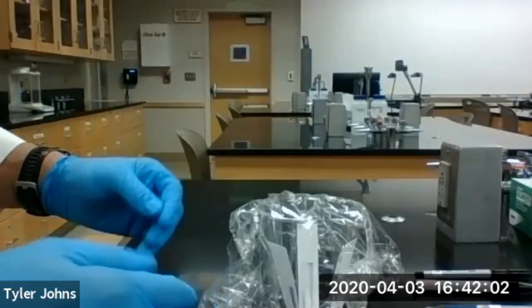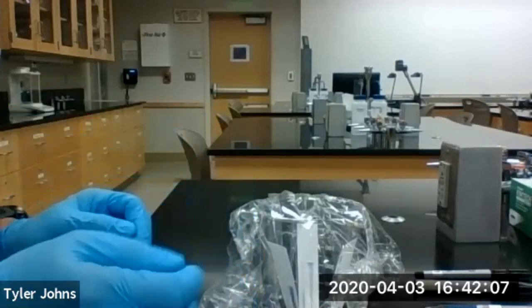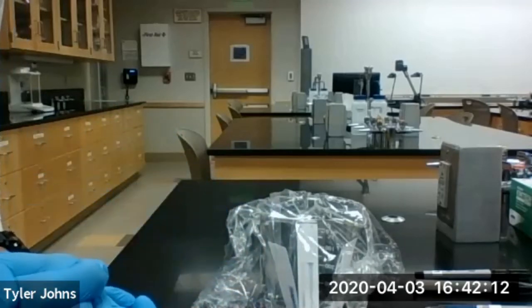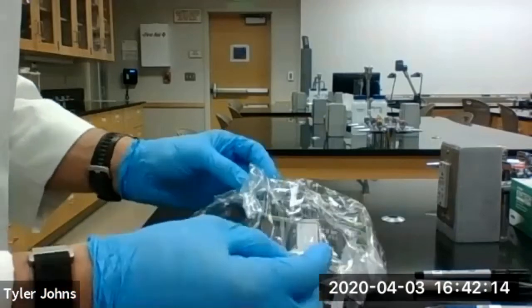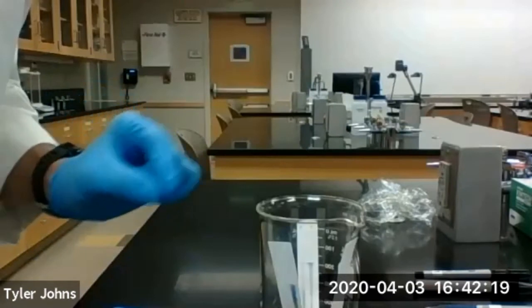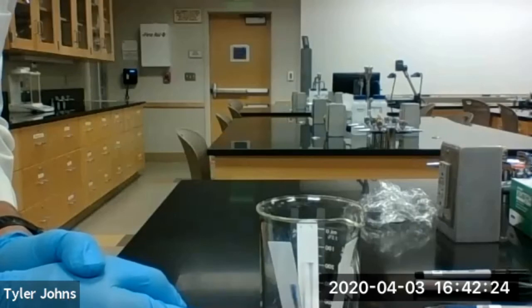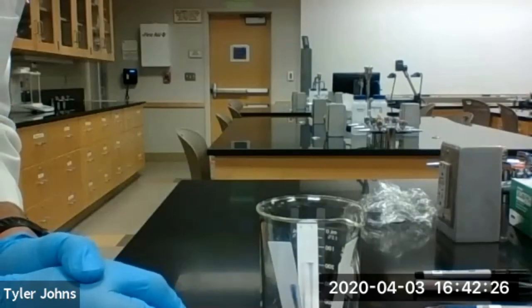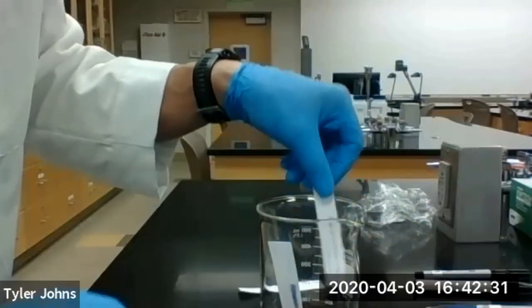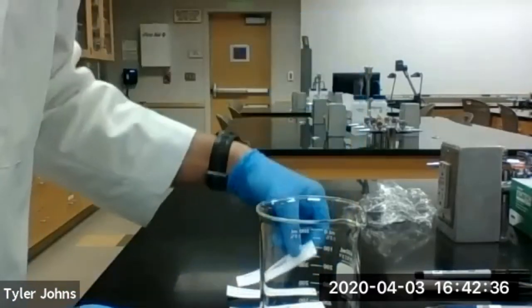We've been allowing our ink to migrate up the chromatography paper for about 45 minutes — that's all we should need to determine who our perpetrator is. We're going to go ahead and remove the saran wrap and remove the chromatography paper and allow them to dry. We're not going to mark the solvent front because we don't need to calculate RF values for this experiment.